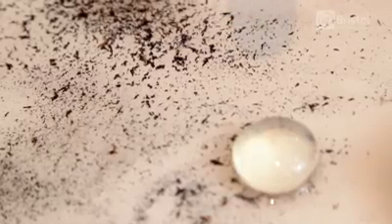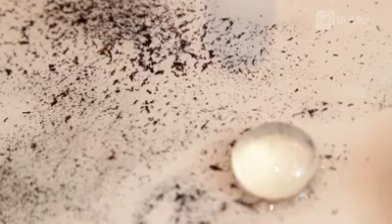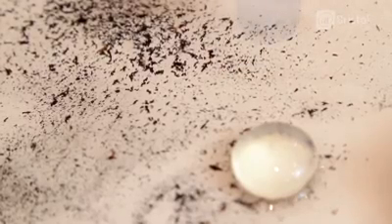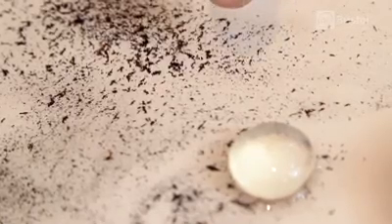Now these black things here are the retina cells — these are a layer of light-sensitive cells at the back of the eye. The retina detects the image focused by the cornea and the lens, and the retina is then connected to the brain via the optic nerve. But after you have frozen and defrosted the eye, these cells become detached.